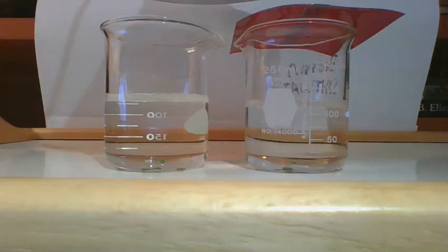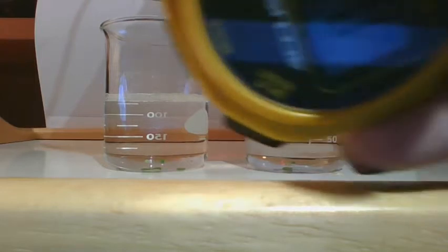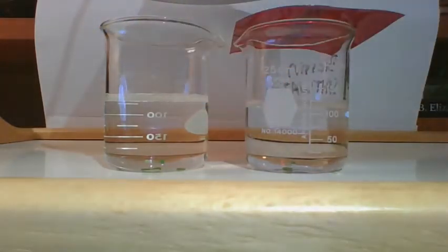Hey guys, if you're looking at this video, you have chosen to investigate how a red filter affects photosynthesis. You should have opened up a document with the data table in it, and we are going to keep track of time with a stopwatch. Your job is to watch as I tell you when. You're going to watch the little leaf discs, which are at the bottom of the screen. You're going to watch them rise up to the top.